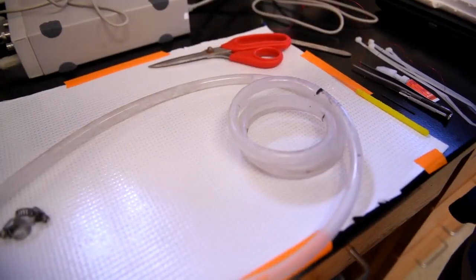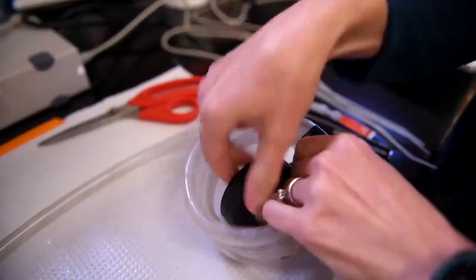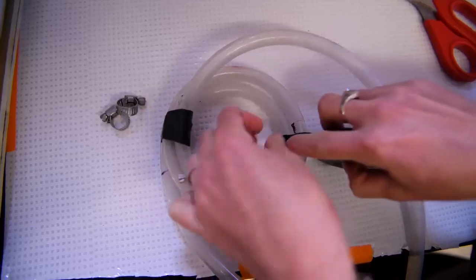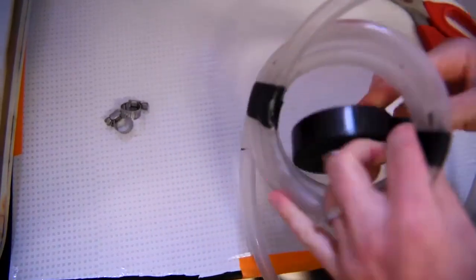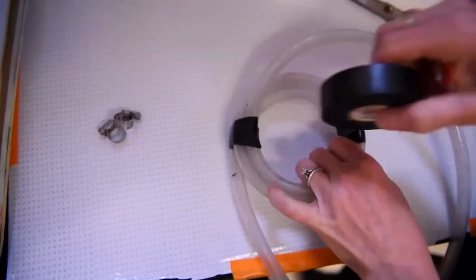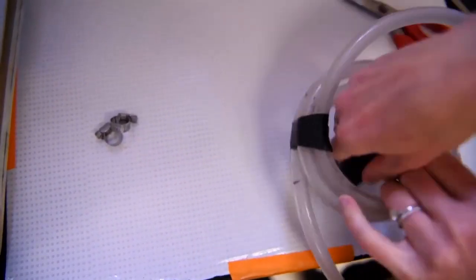Wrap clear malleable tubing around itself to create a heat exchanging coil that is approximately 8 to 10 centimeters in diameter and has extensions that are 40 to 70 centimeters long. Secure the coil using electrical tape.